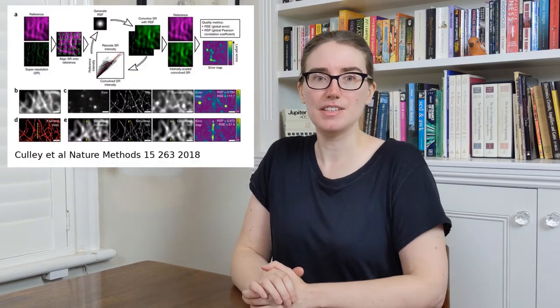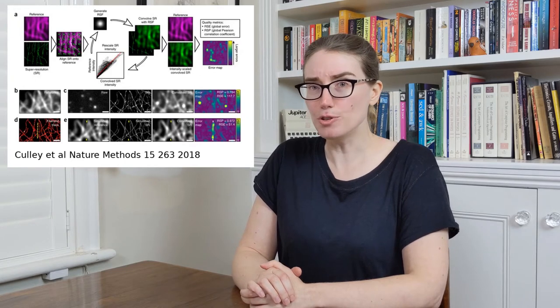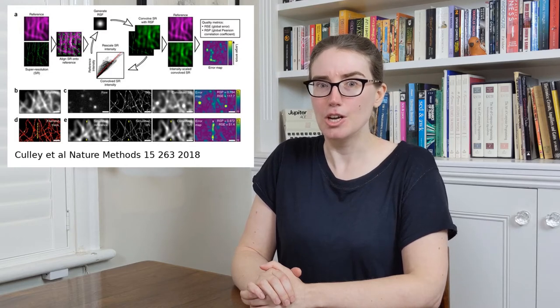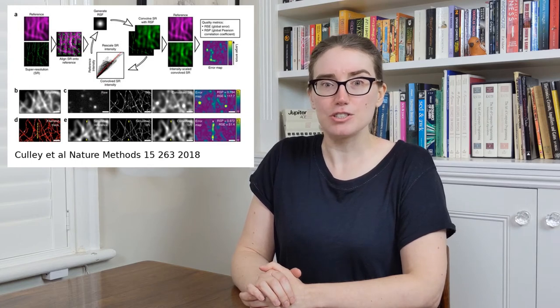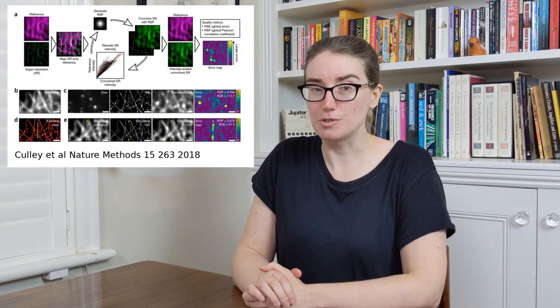Alternatively, instead of comparing the localization microscopy data to itself, you can compare it to something else. That's the approach taken by Squirrel, which takes a localization image and a wide field image and asks how similar they are. This method is really good at spotting missing structures and non-linearities in the data. It's important though when looking at the error maps to understand that they're looking at differences in correlation. You could have the same structure present in the localization and wide field images, but if the imaging is non-linear, and it often is because you're more likely to pick up background localizations than ones from the structure, then it will show up when you map the errors.